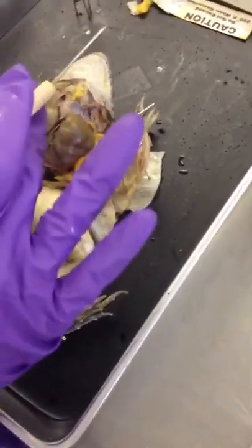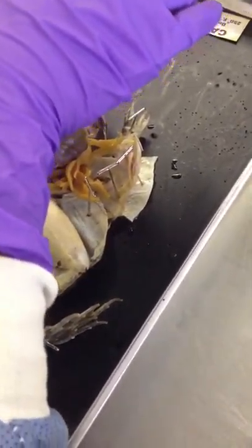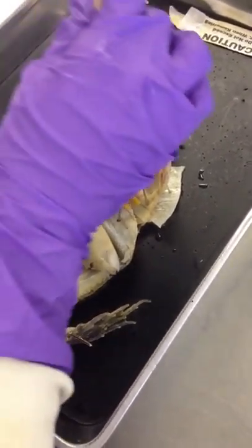Let's start off with: what is this organ? Liver. Whenever we talk about the lobes for the liver, it's always in reference to the organism itself. Not your right, not your left — it's always on the organism.